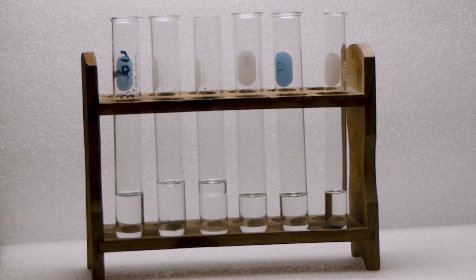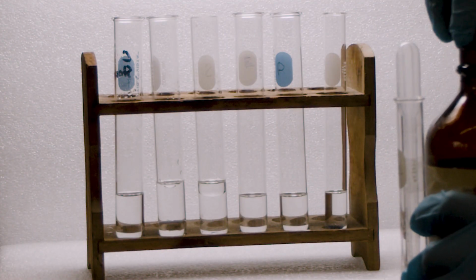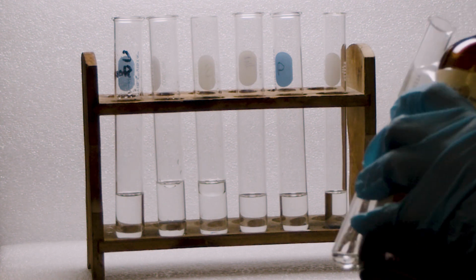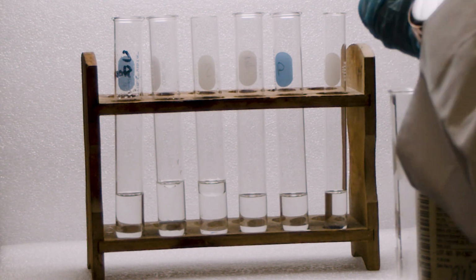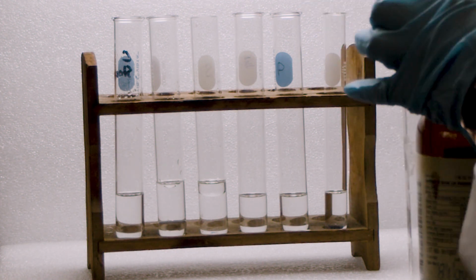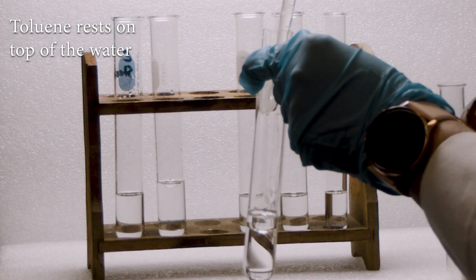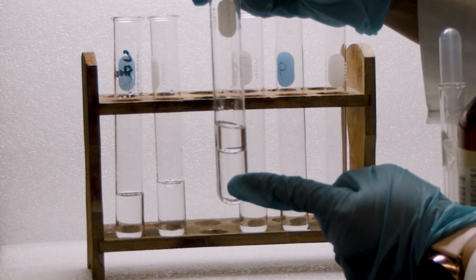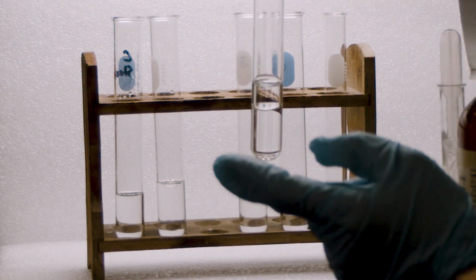Another one is water and toluene, the third one. You may wonder which one is where. Same principle I'm going to use. If my upper layer increases, that means it's toluene. So adding toluene, you can see the upper layer increases. That means it's toluene. So water is denser than toluene. So toluene stays on the top and water remains at the bottom.